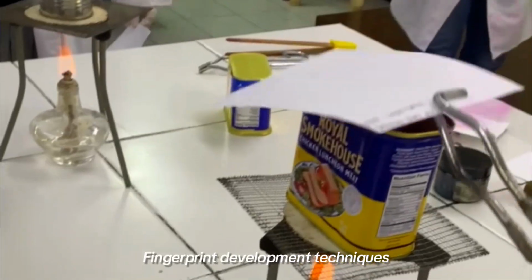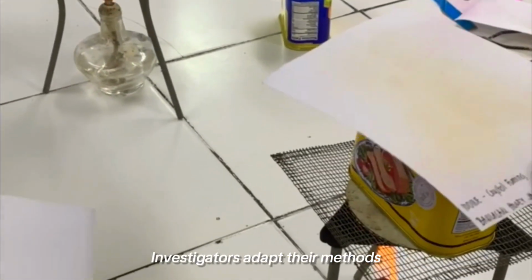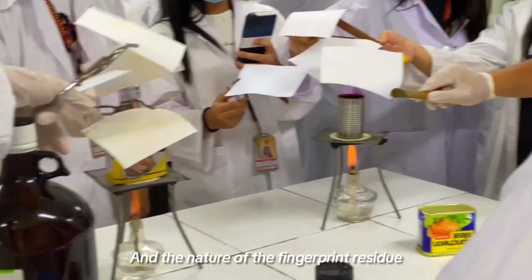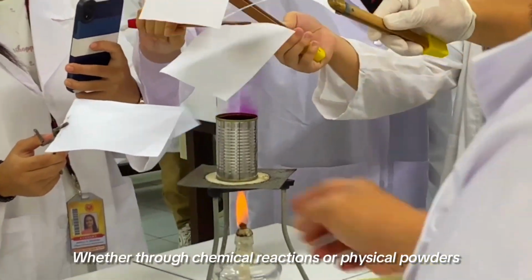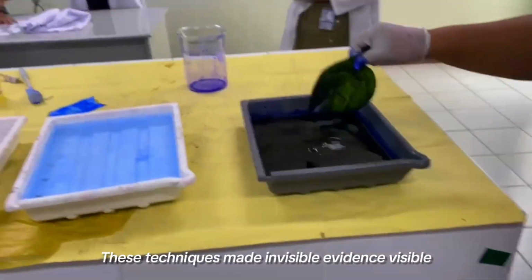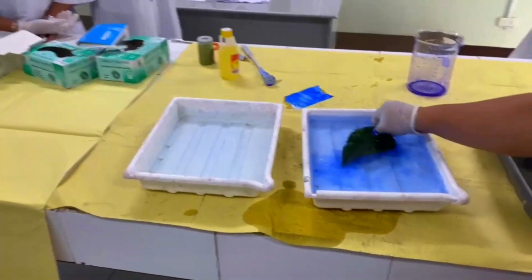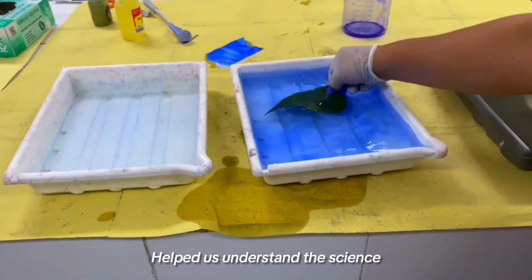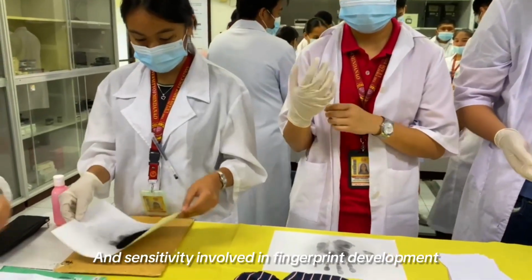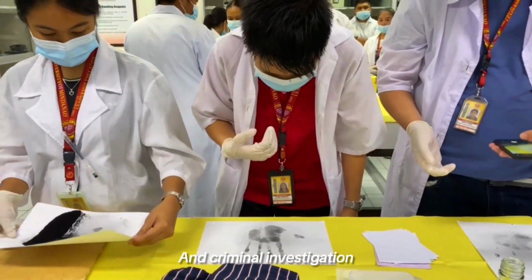Through these diverse fingerprint development techniques, we learned how forensic investigators adapt their methods depending on the type of surface and the nature of the fingerprint residue. Whether through chemical reactions or physical powders, these techniques made invisible evidence visible, helping link individuals to objects or crime scenes. This hands-on activity helped us understand the science and sensitivity involved in fingerprint development, which is an essential skill in forensic identification and criminal investigation.